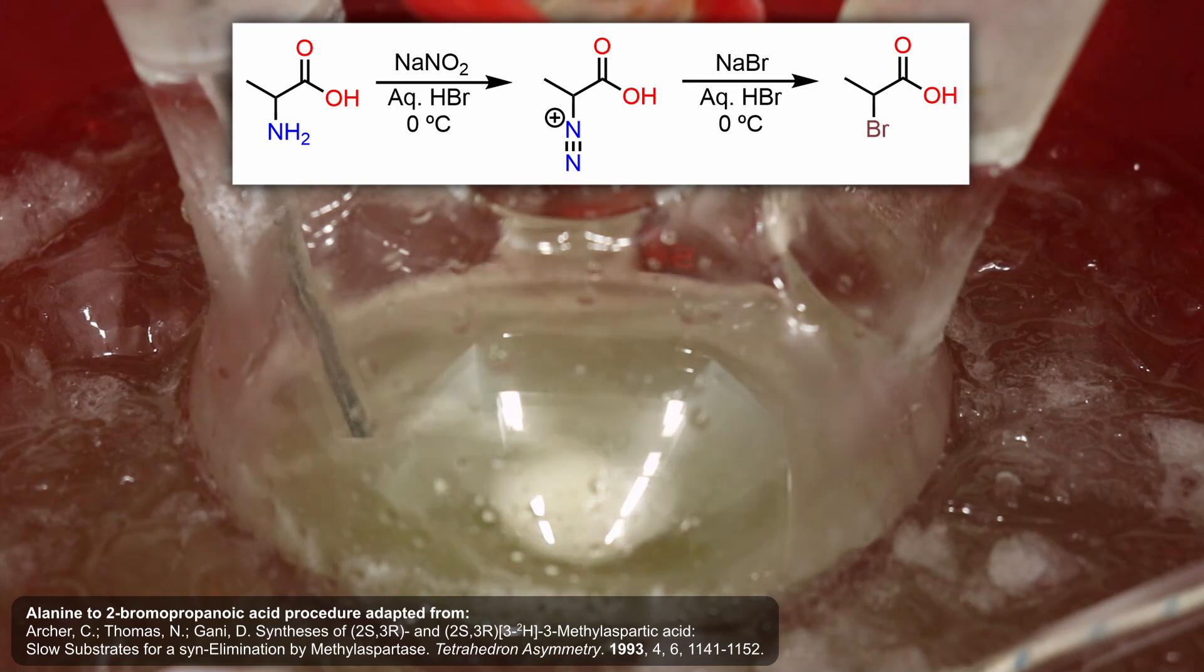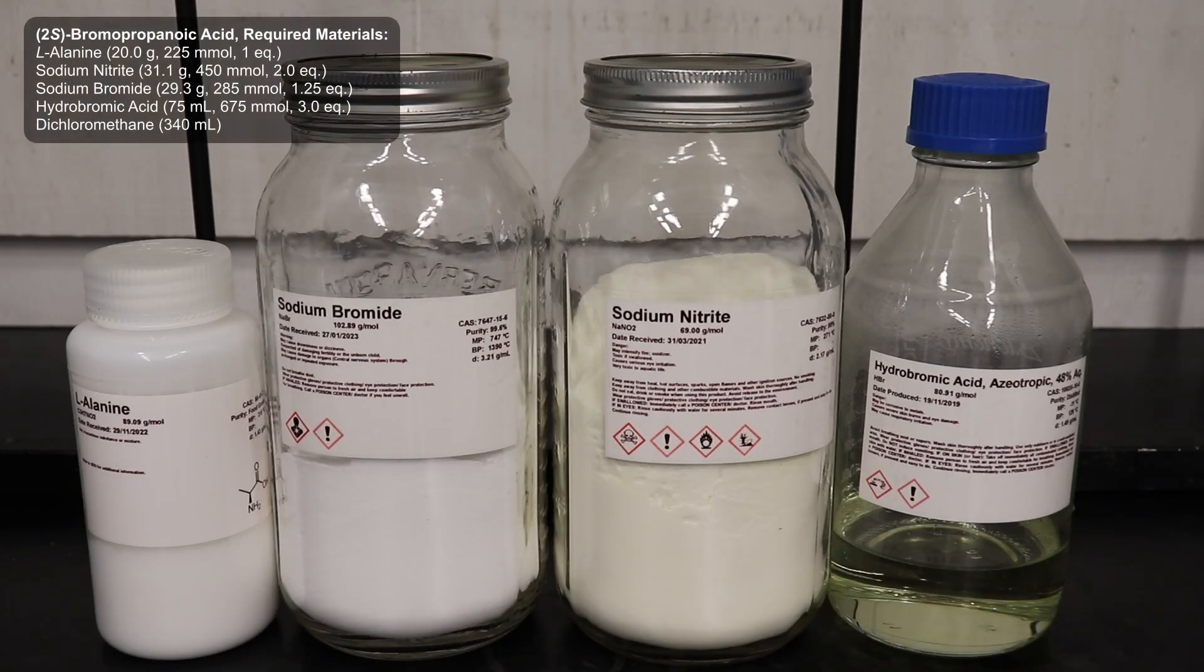requiring the addition of solid sodium nitrite, and it was run on a fairly small scale. So, I ended up making a few modifications to the procedure, and after a few attempts, I came up with this method that works fairly well and runs at a decent scale.